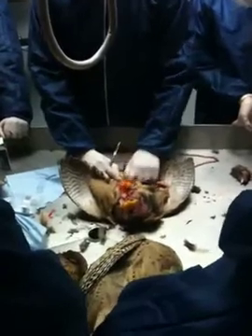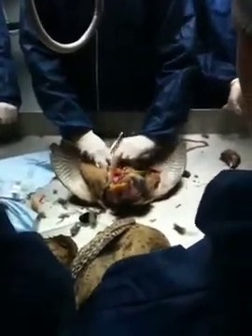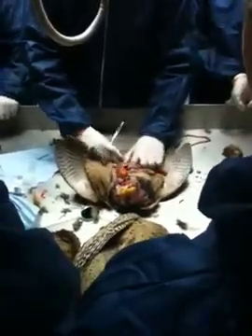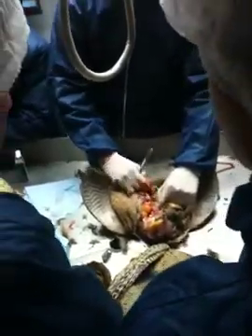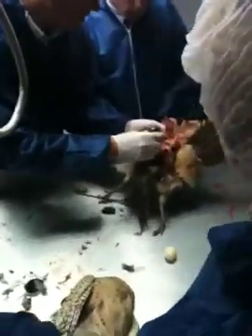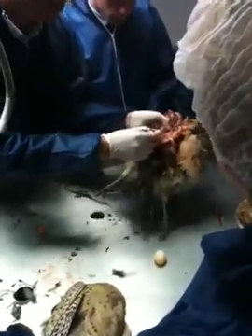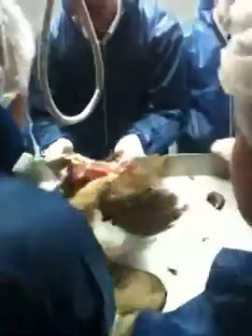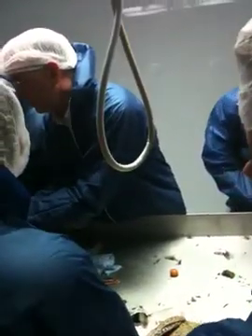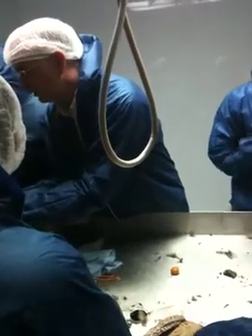Which just leaves the kidneys. So if you dig down in your bird, behind there — there's the kidney, which is embedded in the wall, in the ribs, along the back. That organ there, along the back — that's the kidney. We've talked about urates, the white deposits, and the kidney. So that's the kidney there, stuck in the bottom.